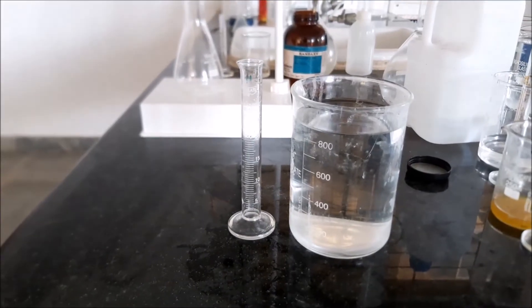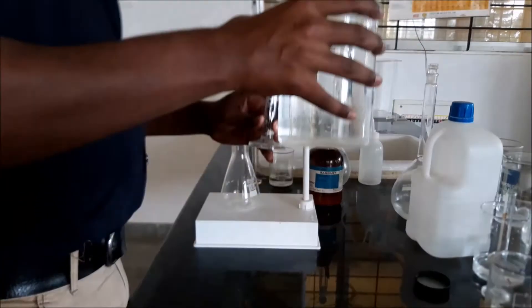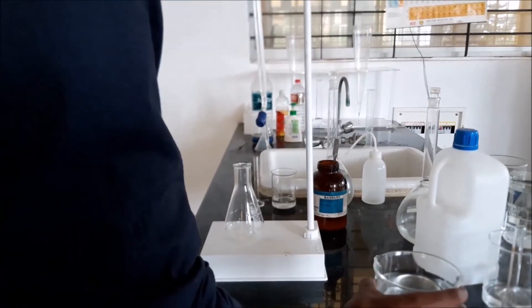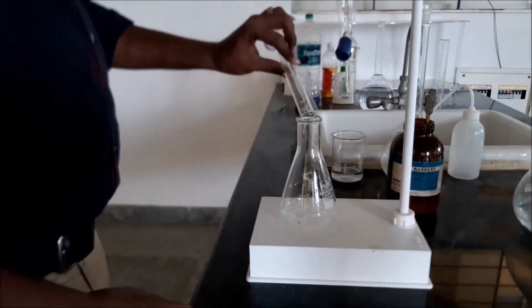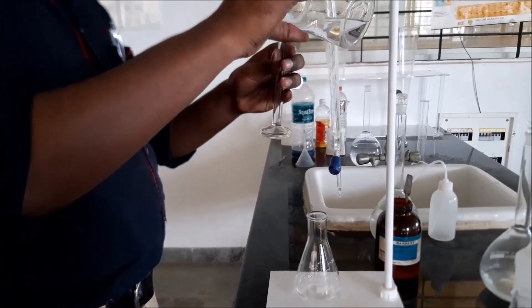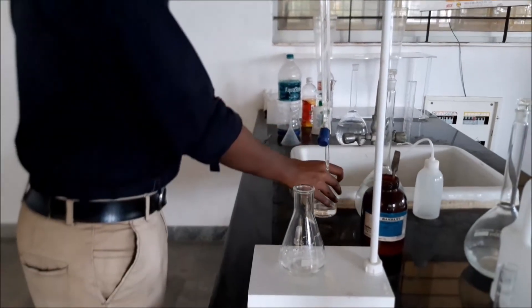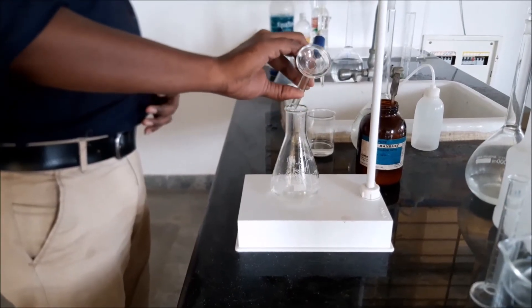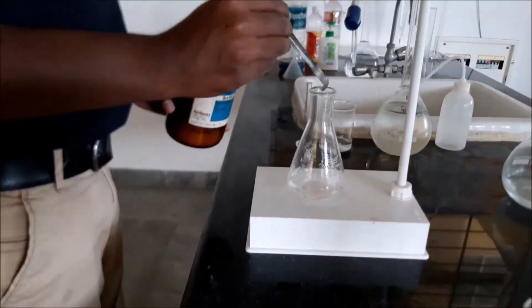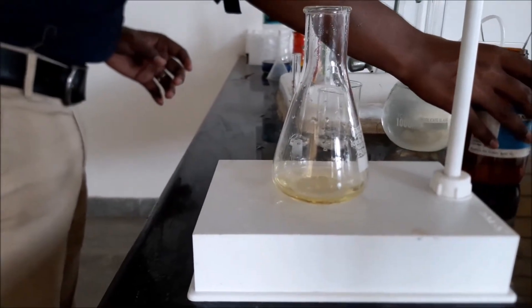We have taken sample five, to which ten ml of chlorine water was added. We take 25 ml of sample and add it to the conical flask. Two ml of acetic acid is measured and added, followed by a pinch of potassium iodide. As you can see, for this sample there is a change in color — it has changed to yellow, indicating residual chlorine is present.